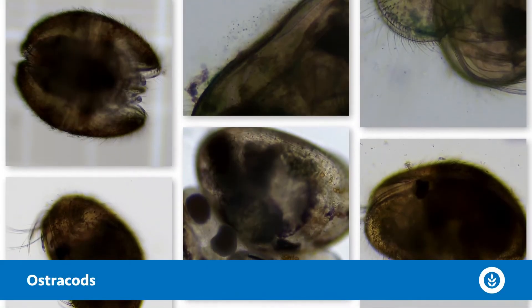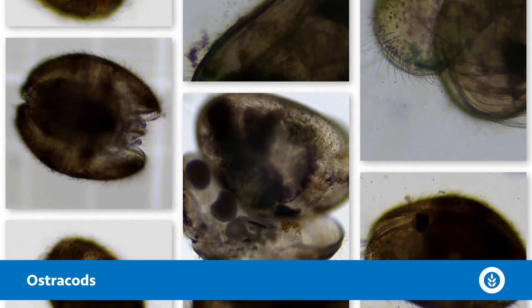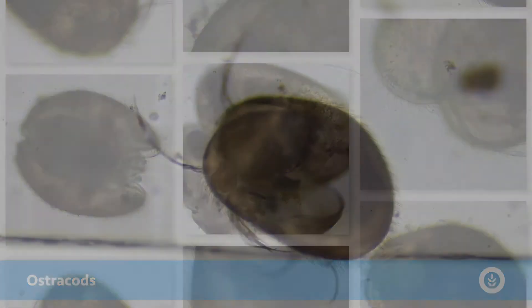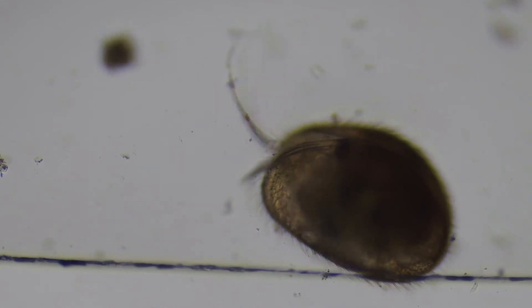First up is a group called the ostracods — a class of classification, but they're actually little crustaceans, a sub-phylum. They're called seed shrimp. They have this cool bivalve shell and you can see their legs coming out. They're around one millimeter in size, varying from about 0.2 to 30 millimeters, with over 8,000 species. You usually see them crawling around eating bacteria, detritus, and algae off aquatic plants and filamentous algal masses. Common species I see are Heterocypris and Cypridopsis.